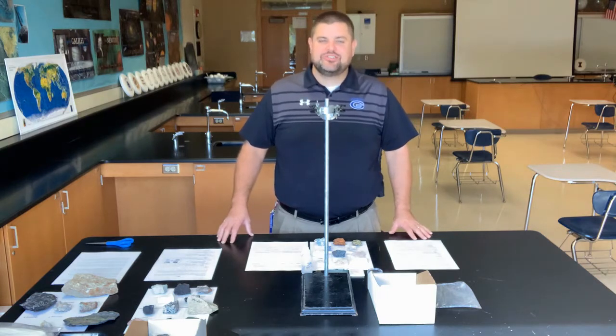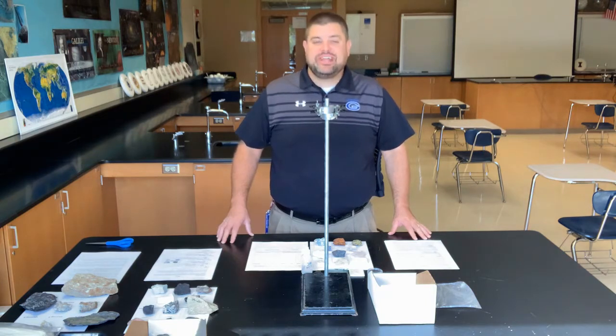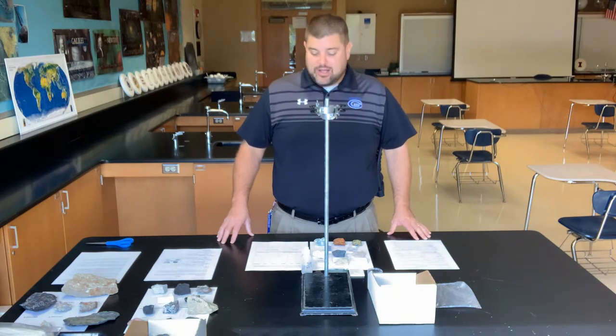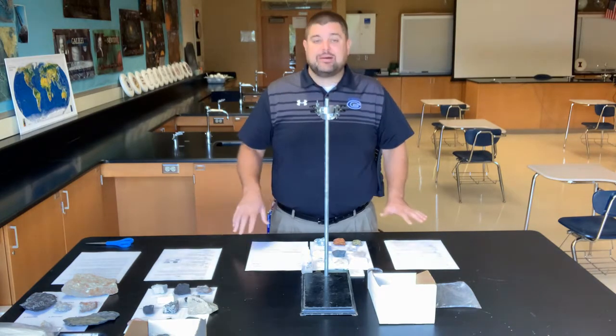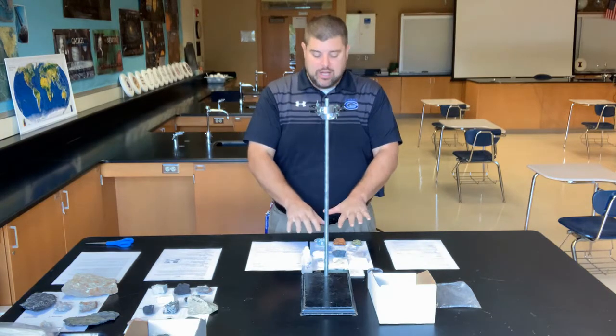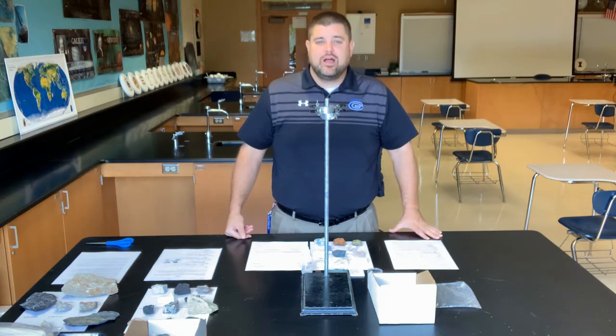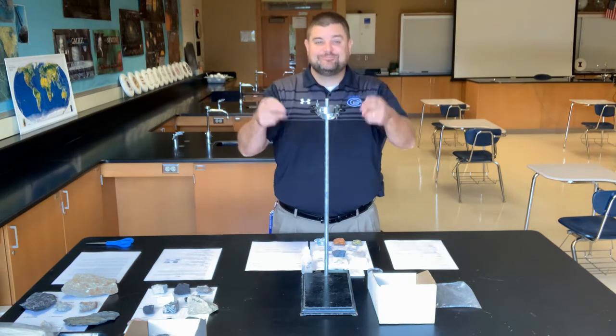Minerals. Minerals is the topic of study for us. We're going to go through and look at some mineral examples and just how we tell one mineral apart from one another. So I have in front of you the lab setup, and I'm going to put the camera here so that you can see what I'm doing a little bit closer and look at some of these mineral samples. So Minerals Lab starts now.